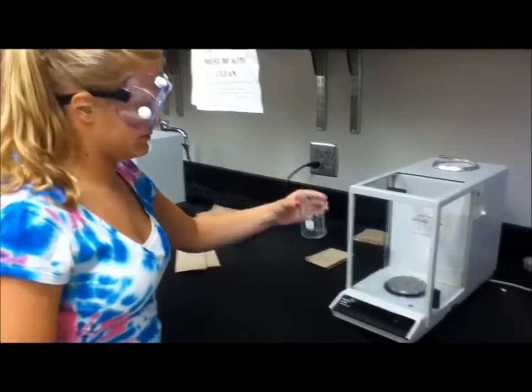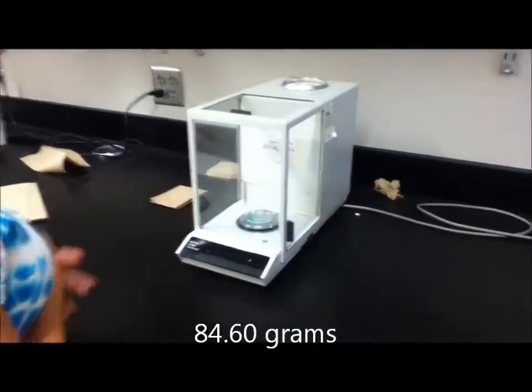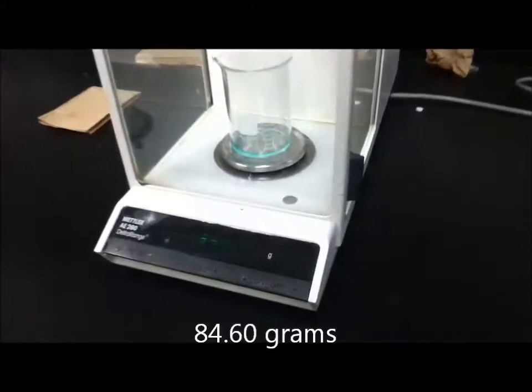Now, Anna is weighing the mass of the beaker with the transferred solution from the pipette. Use the same procedure to weigh the beaker as initially described. Record the data in the notebook.